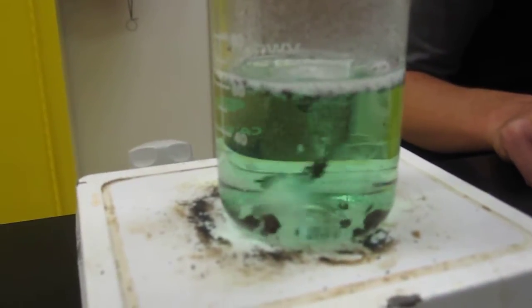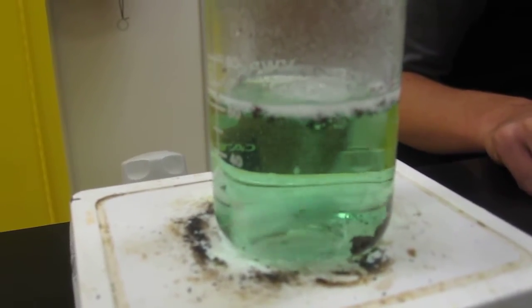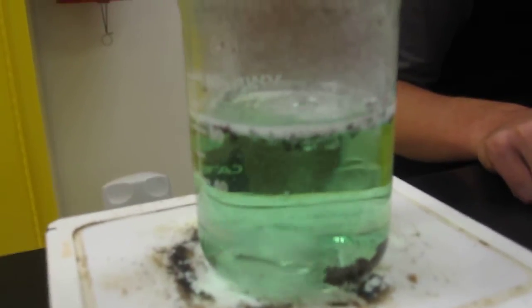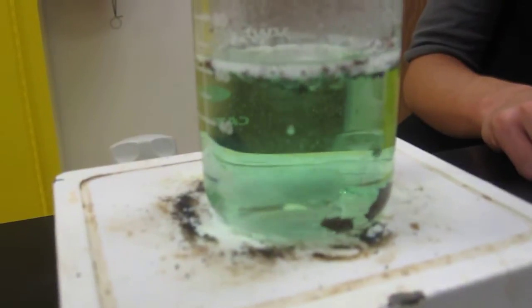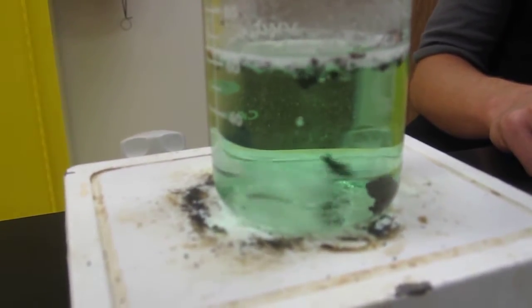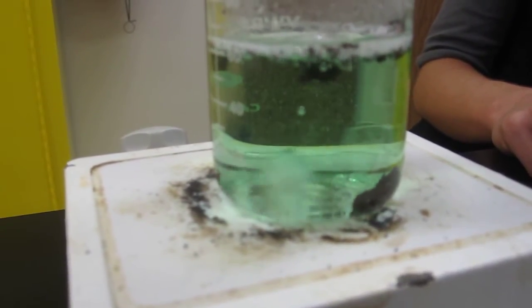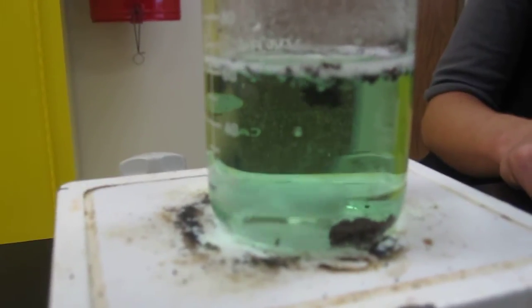Well anyways, hopefully you can see that it is getting less dark blue. Do you guys confirm that? Yeah, I agree with that. Eventually it will become, well now it's very kind of pale green blue and eventually it will become clear.